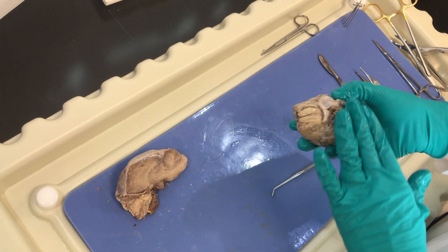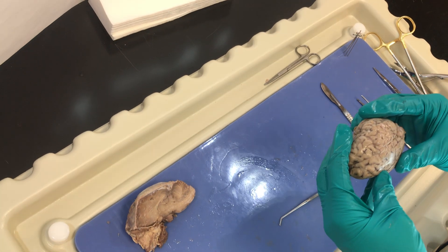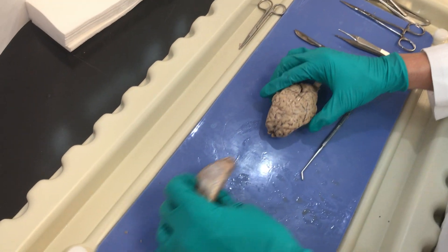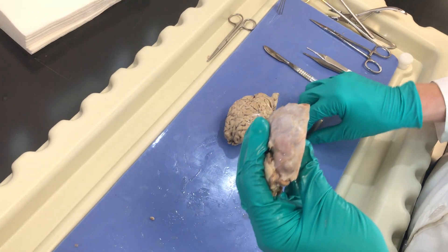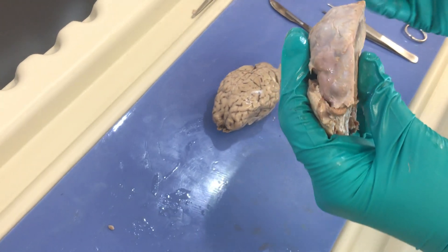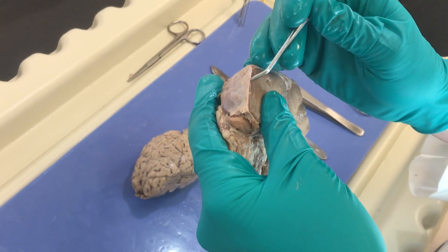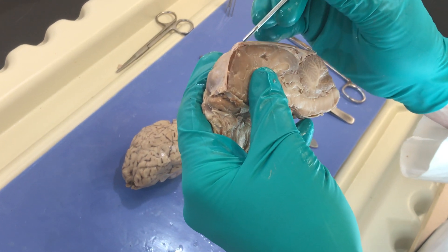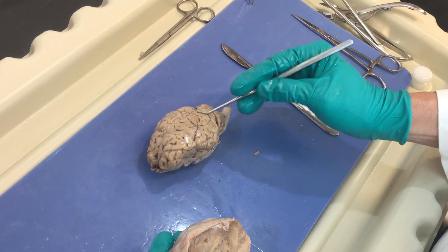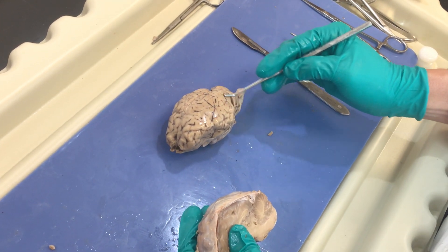If we turn this over, we're gonna see structures on the ventral side. Remember we have some protective coverings on the brain, which in this hemisection of the brain we can actually see very well. We have what we call the meninges, and there are three layers. We have the dura mater, we have the arachnoid which sits below the dura, and then we have the pia mater. Here you see this glistening aspect with the vessels — that's gonna be the pia mater.